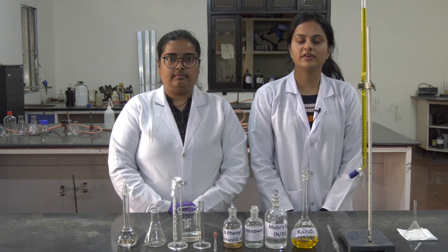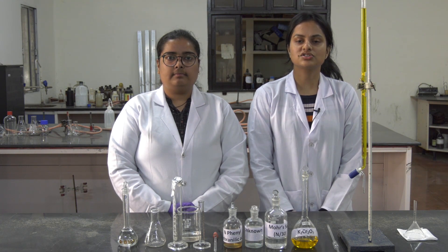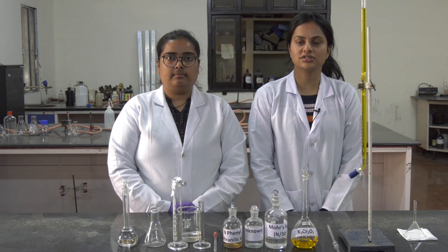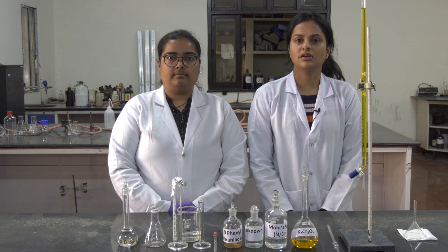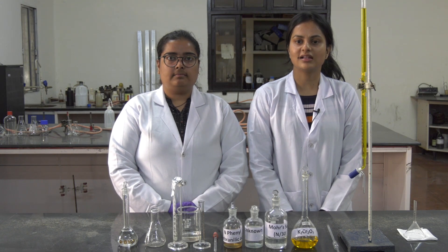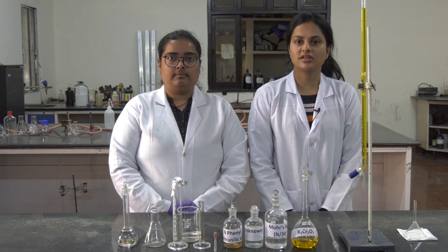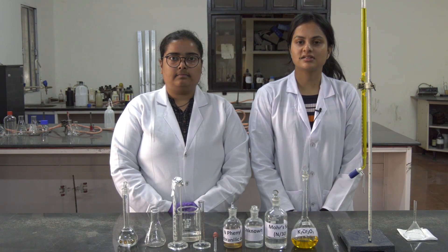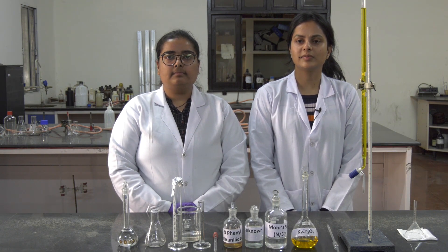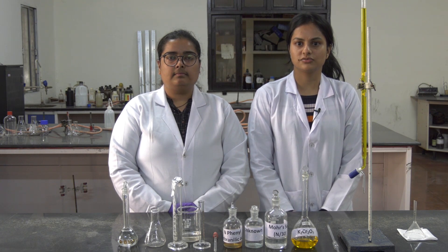Hello everyone, today we will be performing a redox titration. A redox titration is just like acid-base titration, and today we will use a redox indicator which is N-phenyl anthranylic acid. The aim of this experiment is to determine the iron present in ferrous ammonium sulphate solution, which will be titrated against potassium dichromate solution.